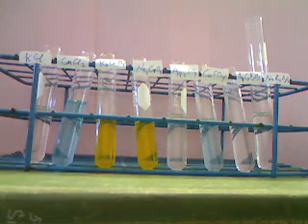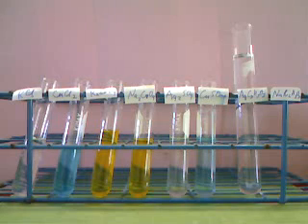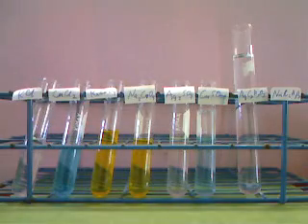And so there's the result of the sodium acetate added to the other 7 solutions. So now we've combined all the solutions in that row on our table. Now I have to go down to the next row and combine the solutions in the next row on our table. And so now we're on to our next solution, the silver acetate, and we'll combine it with our 6 remaining solutions and see what happens.